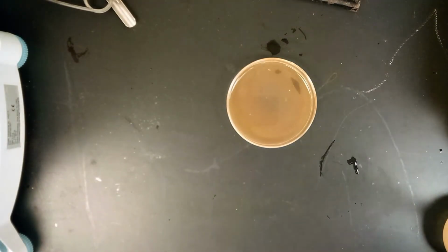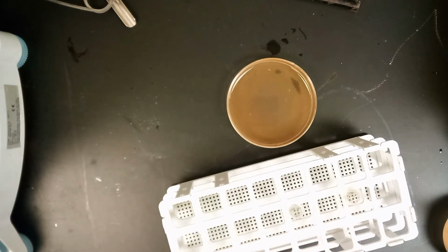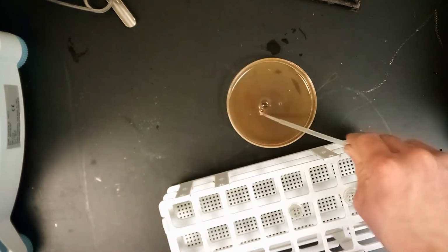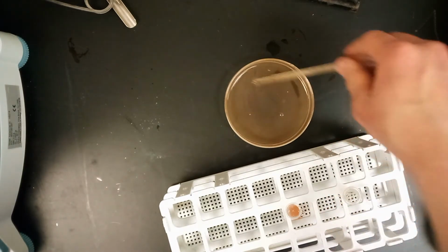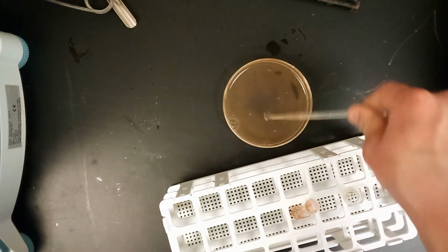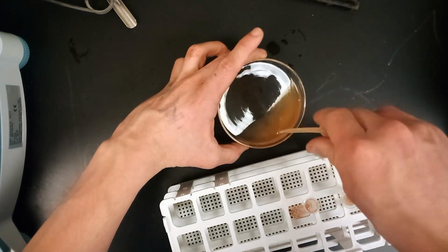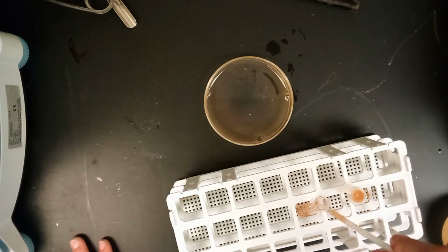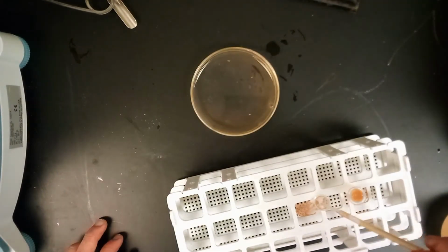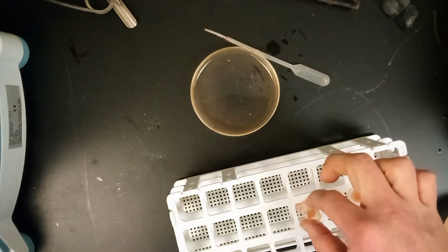But now we can use this solution that we've basically made for part B of the introductory activity, where we'll use these two test tubes. We need to put about equal amounts into each of these two test tubes. The one on the left we'll call test tube A, and the one on the right we will call test tube B. A will be our control test tube that we'll be comparing the results from B to once we submerge B into the hot and cold water baths. So yeah, there we go.